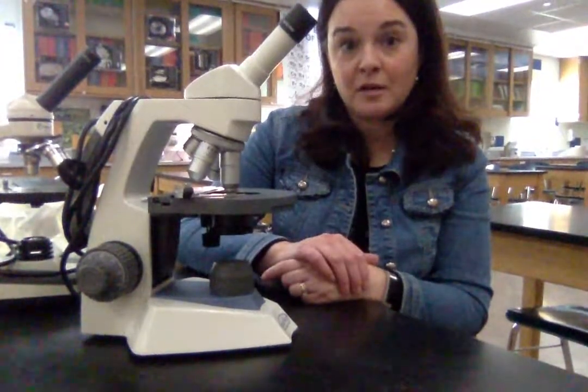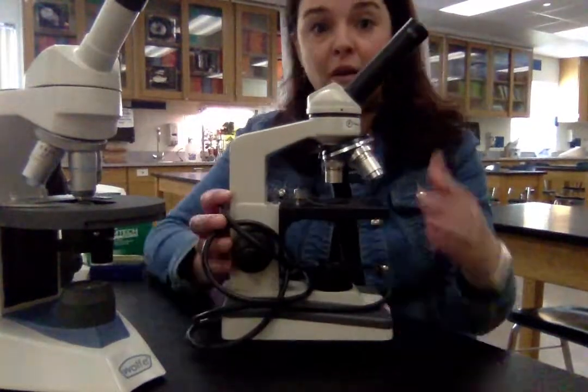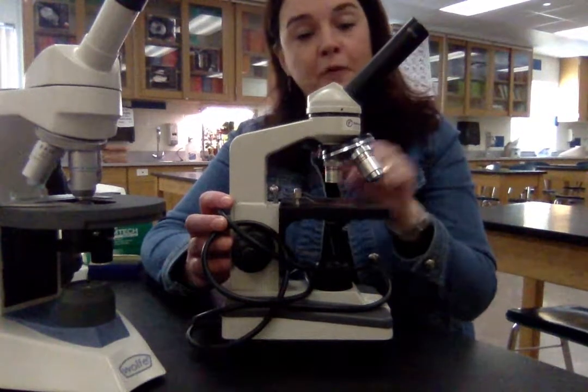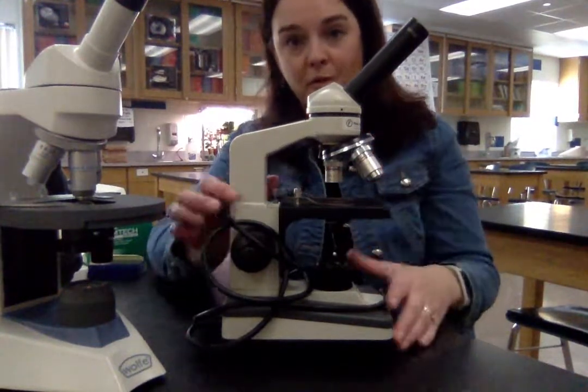If you turn to the middle objective, it's labeled yellow and has the number 10 on it — this is medium power, with a total magnification of 10 times 10, or 100 times. The highest power in our classroom microscopes has a magnification of 40 times 10, so 400 times magnification. On our older microscopes, these still have a rotating nosepiece, color-coded, with 4, 10, and 40 — so low, medium, and high are still 40, 100, and 400 times magnification.